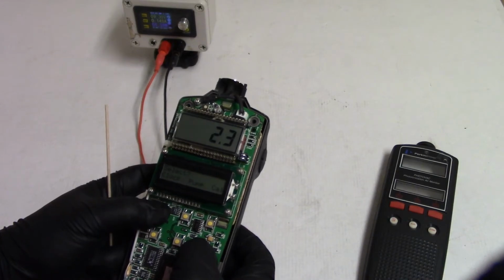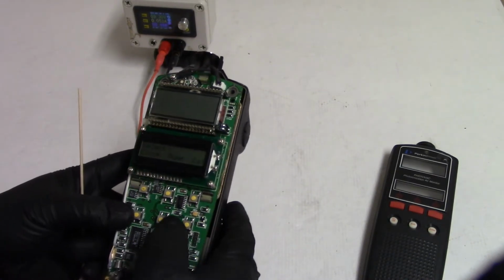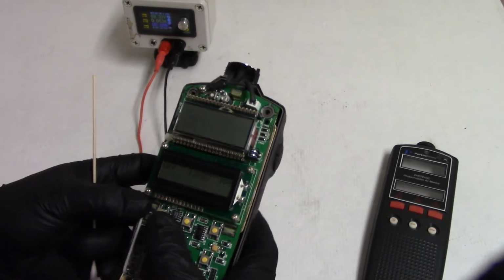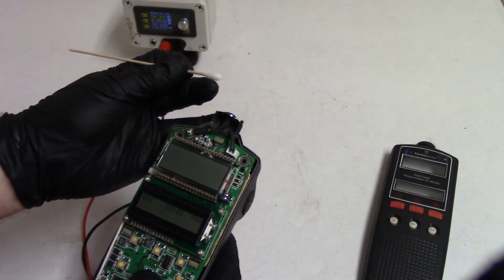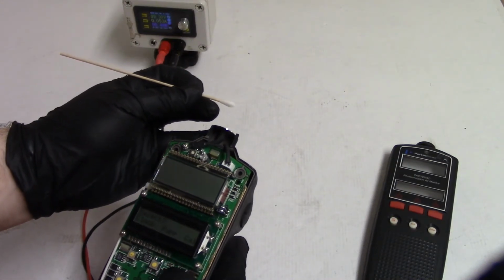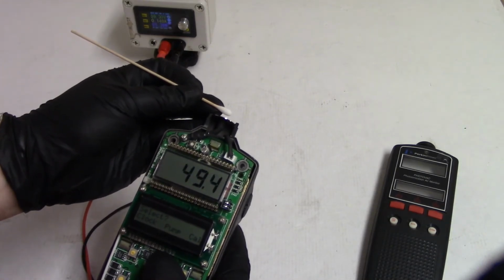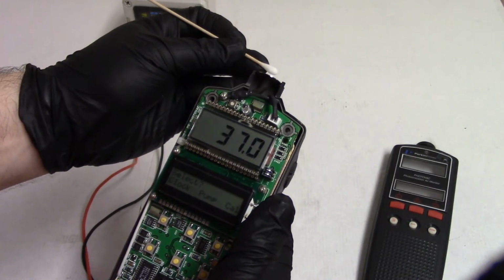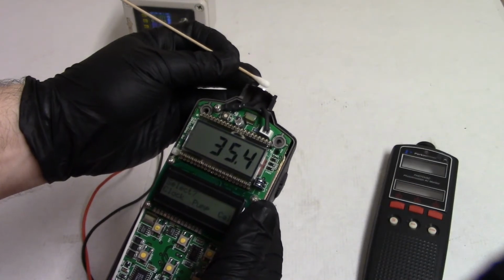Set. Clock. Pump is off. There we are. Okay. Let's exit. So, now I think we can start over. So let's see, how do I tell it to go? Enter. Set. Pump. Pump is on. There we are. And it's drawing about 150 milliamps at 9.3 volts.